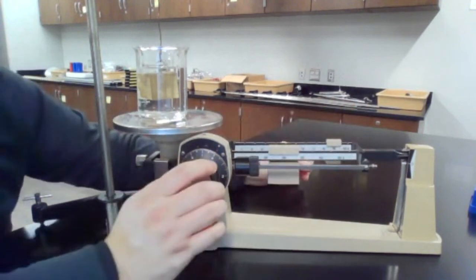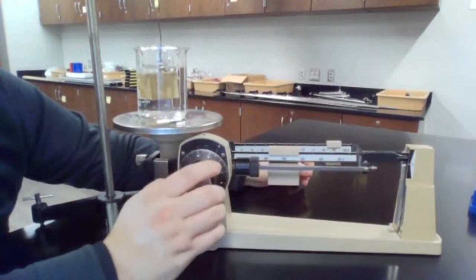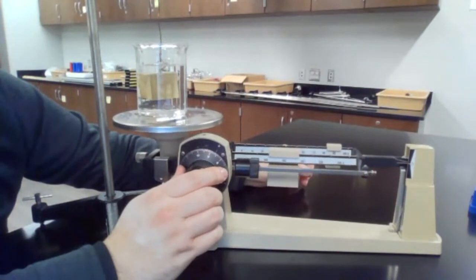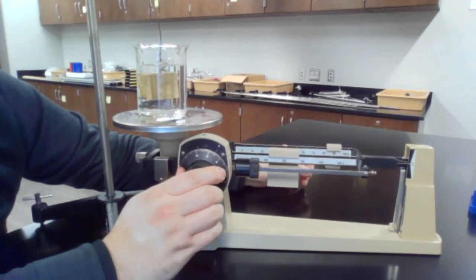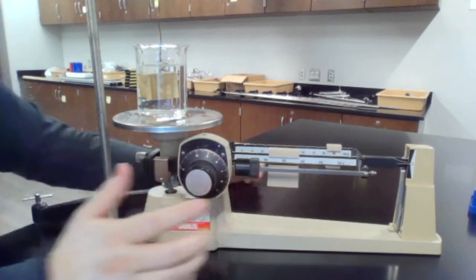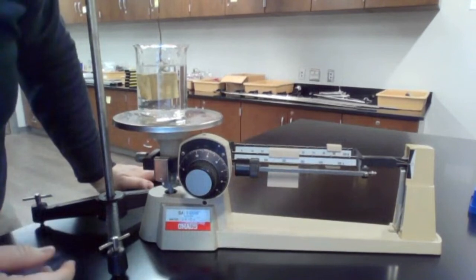So it's 290 something. All right, so this will be 298, 298.550.